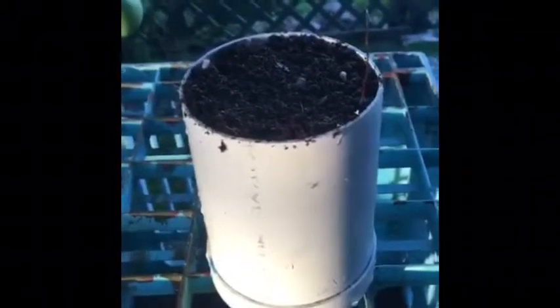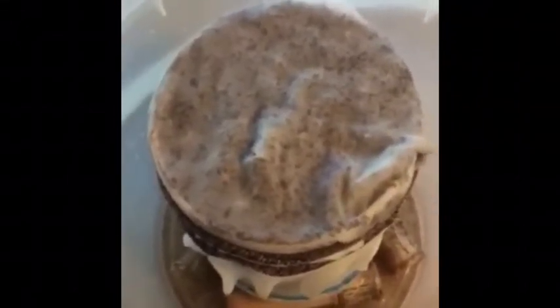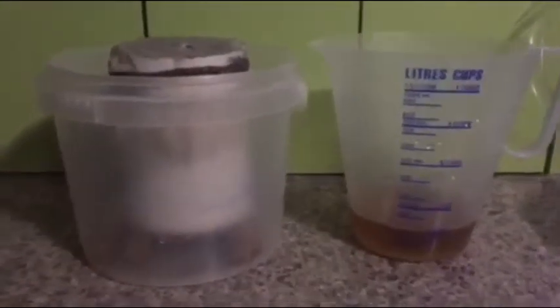Here it is draining — we'll let that go for a couple of minutes. We've done our soaking, taken off the top, and removed the excess. Now we put the gauze on and it's ready for the next soaking. We set the gauze-covered bottom half in the water — it tends to float so we hold it there. Here we have the gauze-covered apparatus draining; we'll let that sit for 30 minutes, then measure the water collected. We covered the holes at the bottom, lifted it out, let the water drain off. After half an hour of draining, we have a spot-on reading of 125ml, and we'll record that in our paperwork.